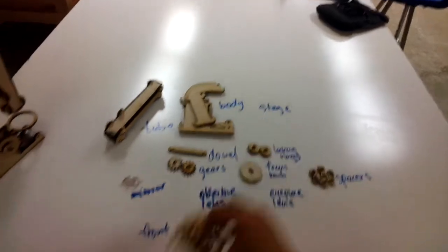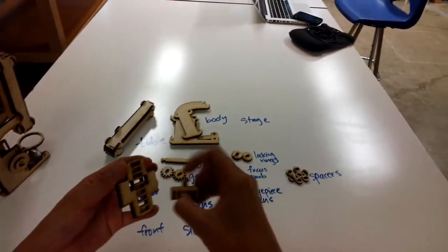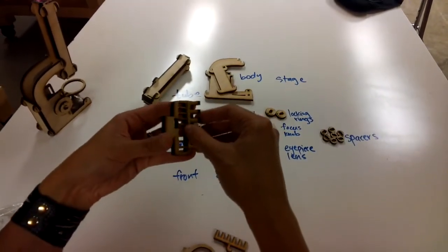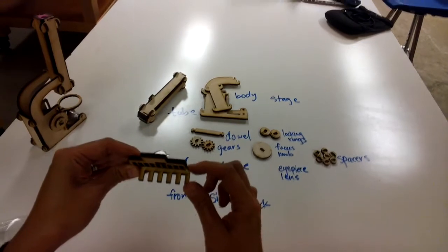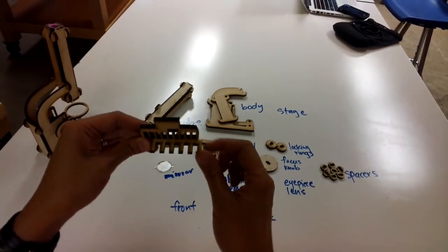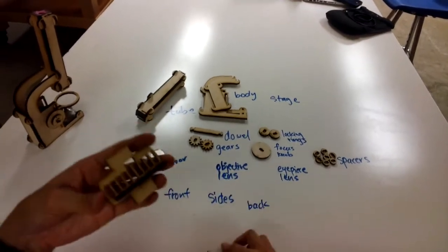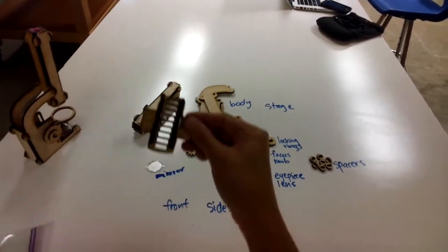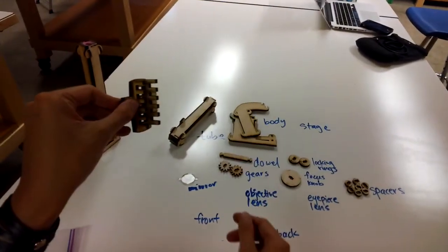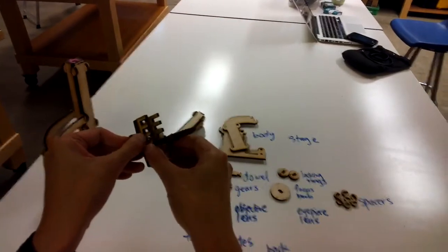So grab all the pieces for the stage, and this part's pretty easy. You're just going to put the little combs or the little hooks through this little rectangle thing here. When you slot it in, you'll see that there are two ways to slot it in. In one way, you'll make this little overhang, and this thing is kind of sticking out. You don't want that. So flip it over if that's the case, and make sure you make a little stage that has nothing sticking out. So your stage should look kind of like this. And then the ring is just going to go on one of these little levels here.